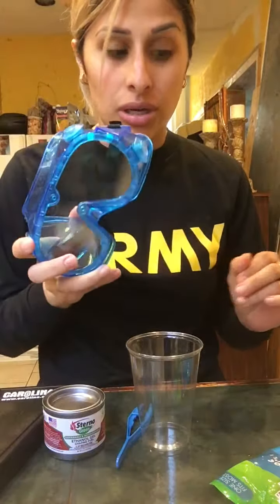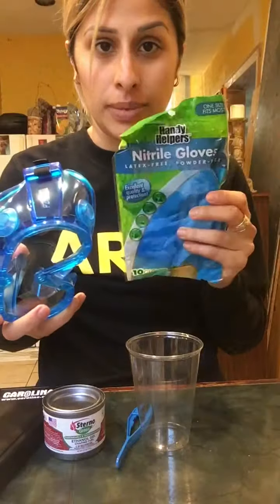Hello, my name's Judith Gonzalez, and today I will be performing the Atomic Emissions and Flame Test lab. First and foremost, for this lab, we do need to use goggles and gloves for safety.